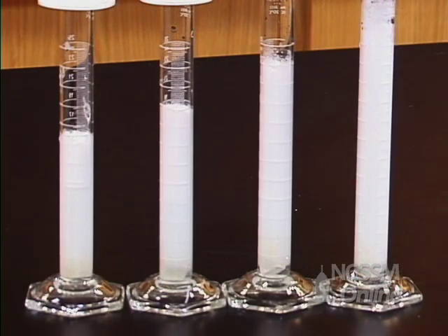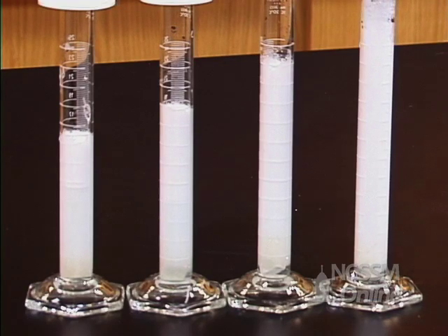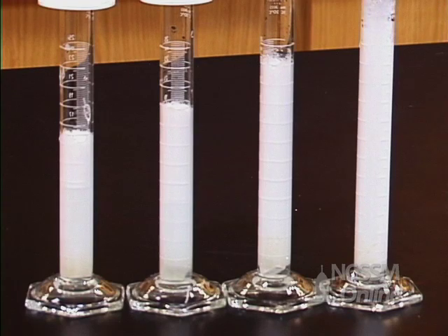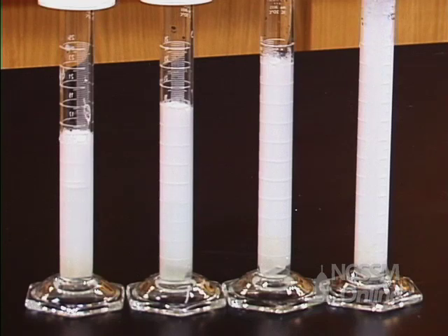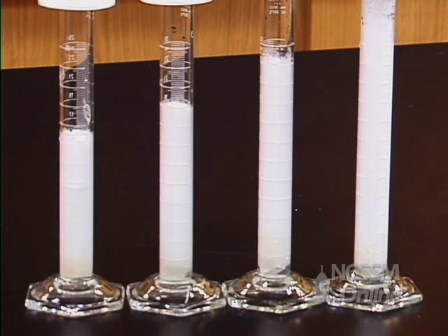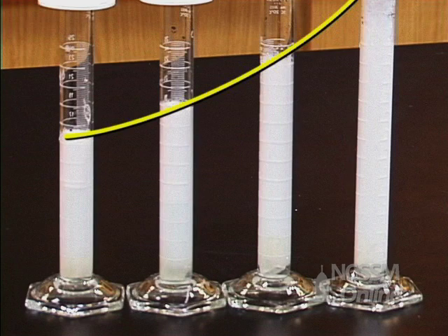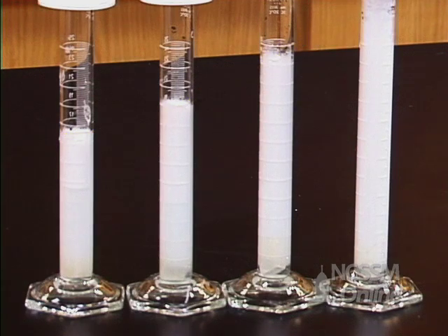After five minutes has passed you can see that with increased surface area, the rate of oxygen produced is much greater. If we graph this data you would find that it's actually exponential — you can see the line that starts from the first one and curves slightly upward to the last one.